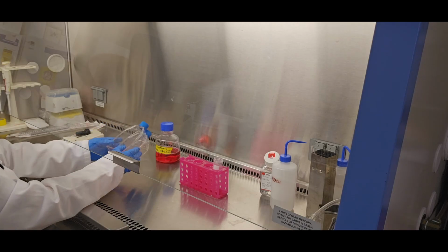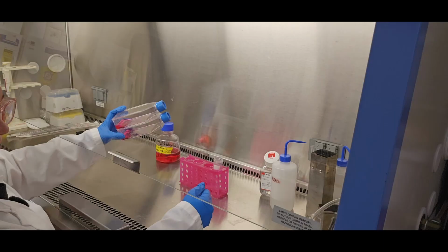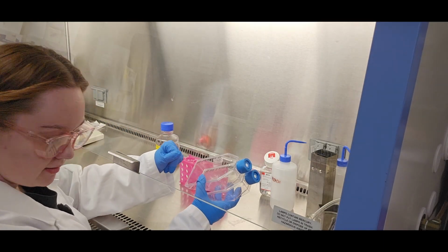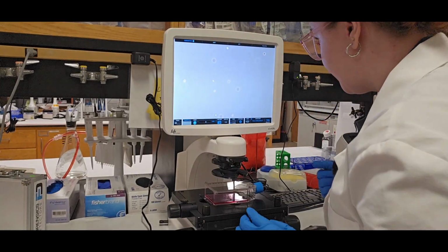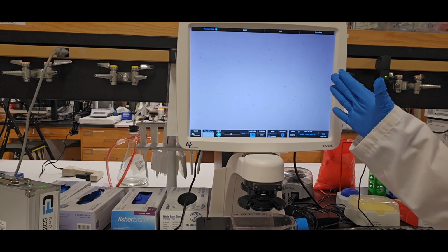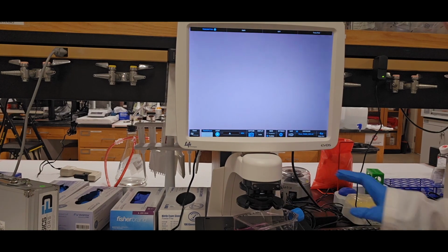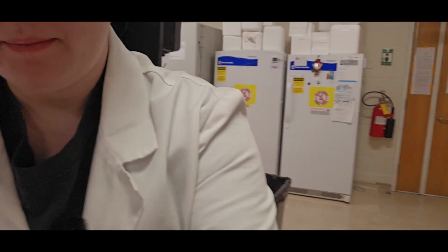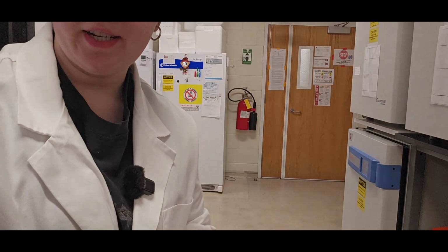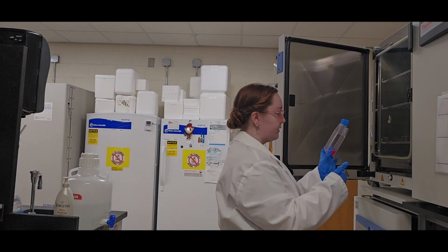And there's my cells. Now I'm gonna check to see if cells actually made it in this flask and if it looks pretty similar across the flasks. Seeing cells in this flask. Here's that in 4x. Yeah, there's cells here as well. One by one, I'm gonna spray these because they were individually sitting on that microscope, which is not clean. Spray them and put them in the incubator. Again, handling them by the bottom.